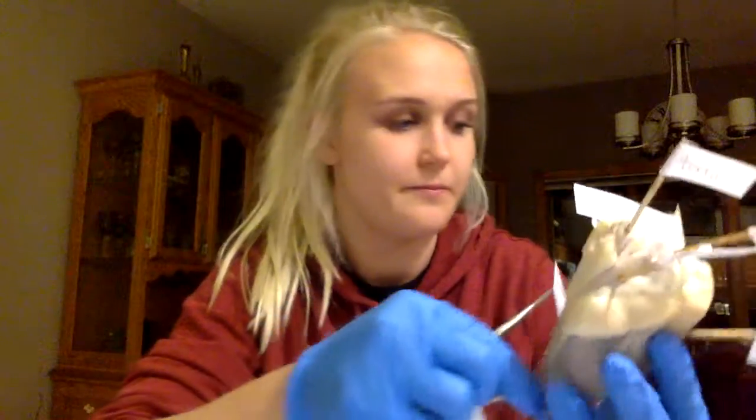First, I will start with the apex, which is located at the bottom pointed left ventricle, and it consists of muscle right there. On the other hand, I have the base poked in over on this side. The base is in the mid or upper right area, and it is the point of attachment for blood vessels entering and exiting the heart. I have it right here.